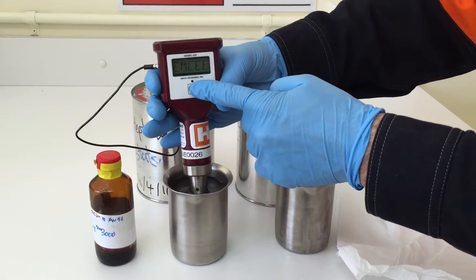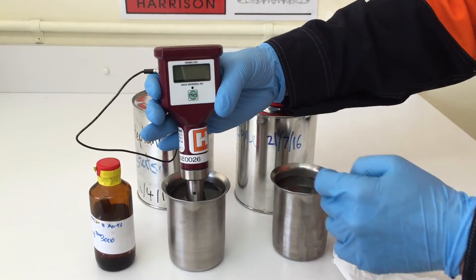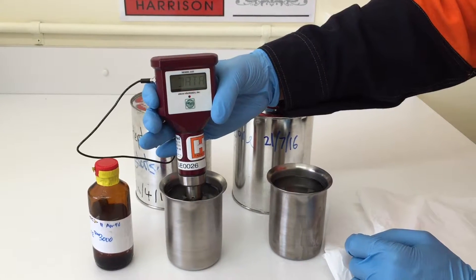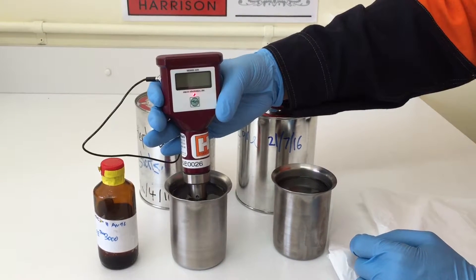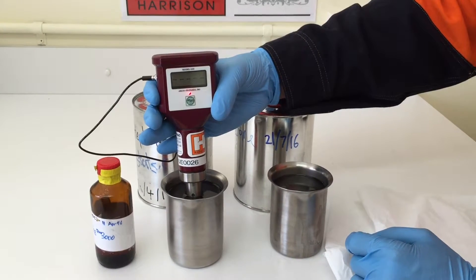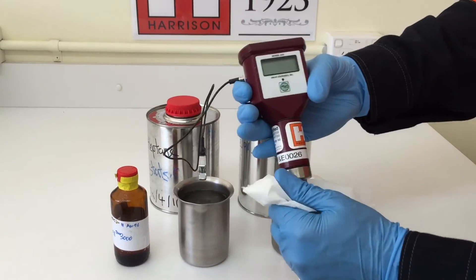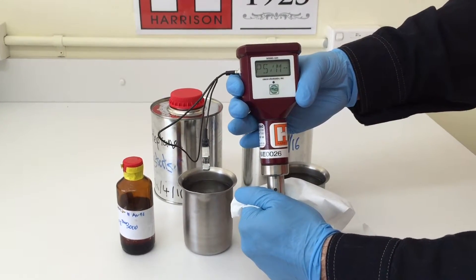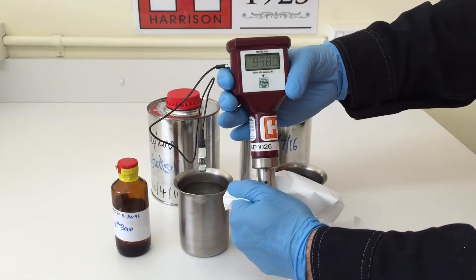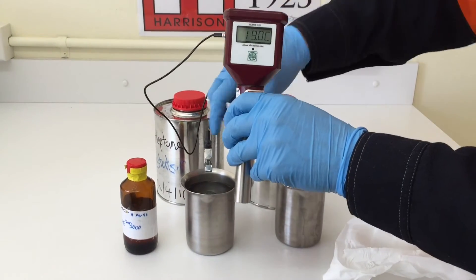Press the button once, then press it again to read the conductivity. Once the light turns off we can take it out of the sample. The conductivity is 9,980 pS/m, which is a safe working level.